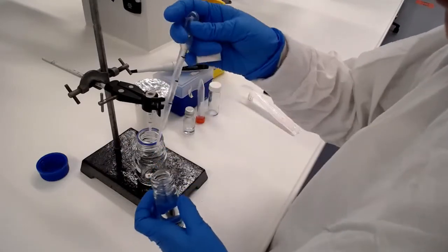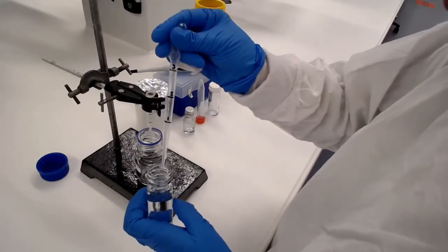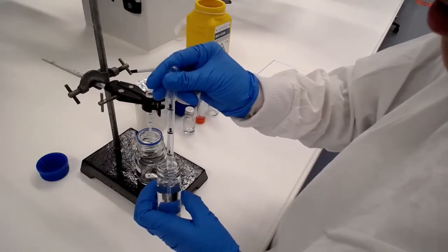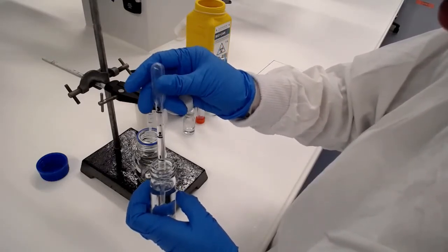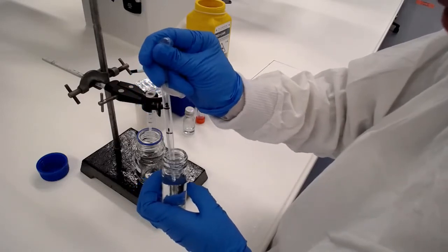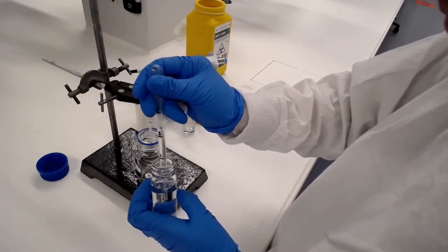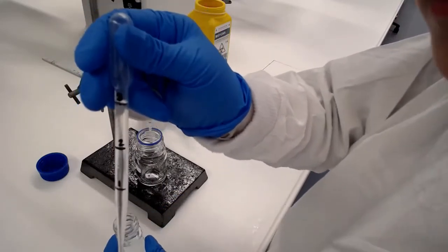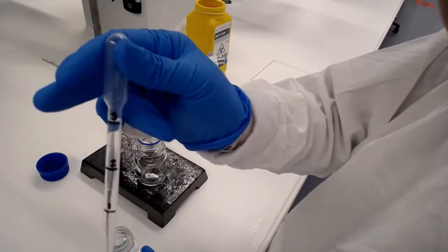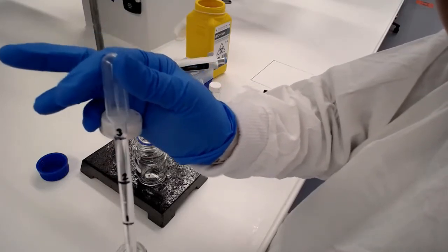Note that throughout this procedure we're not going to use perfect aseptic technique. You may see Shang put lids down on the bench or touch the tip of the pipette with her fingers, and that's because what we're really doing here is biochemistry rather than microbiology and the need for aseptic technique is not quite as important.